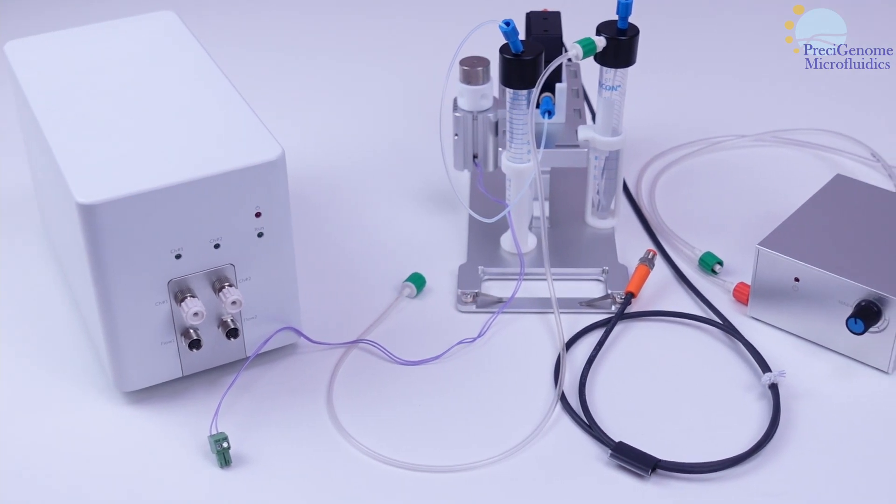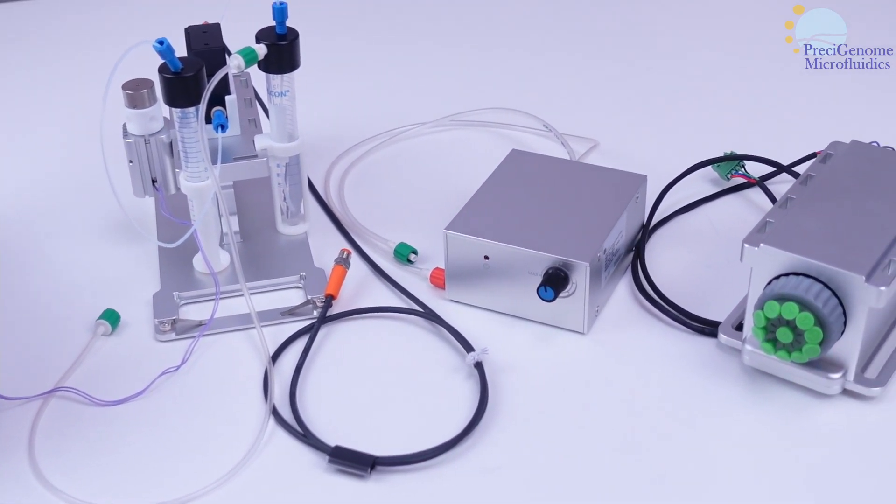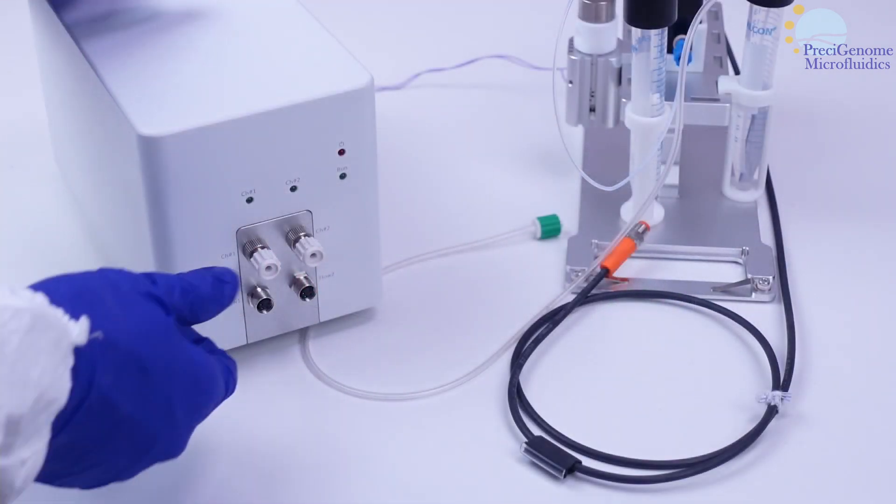In this video, we will show how to connect an iFlowLite pressure controller to common components of an experimental setup.